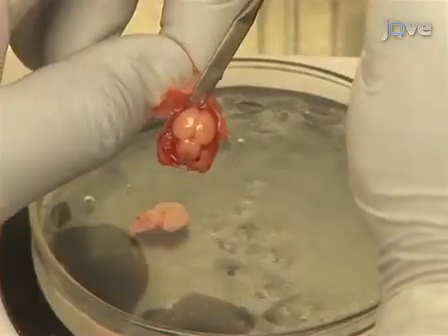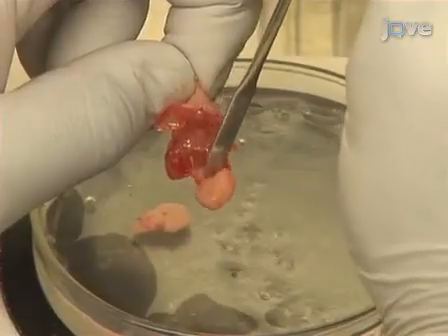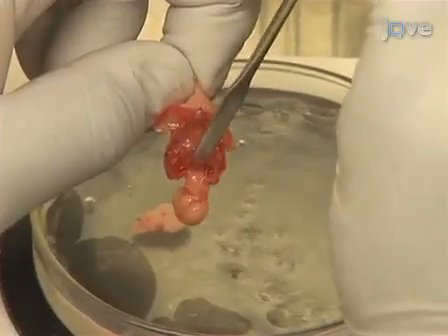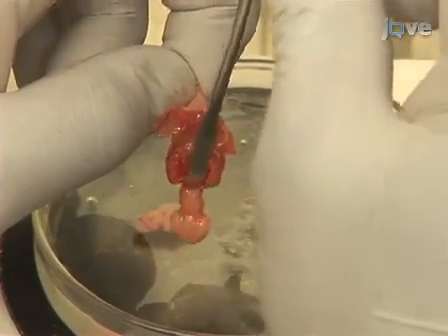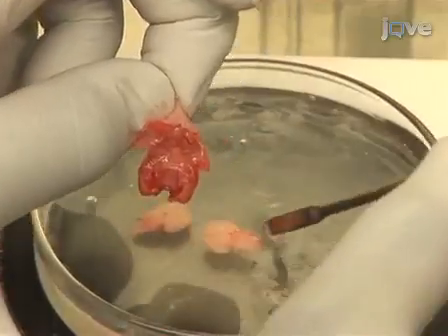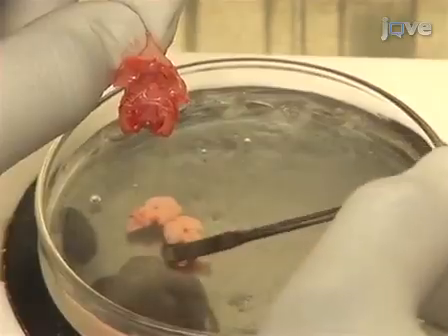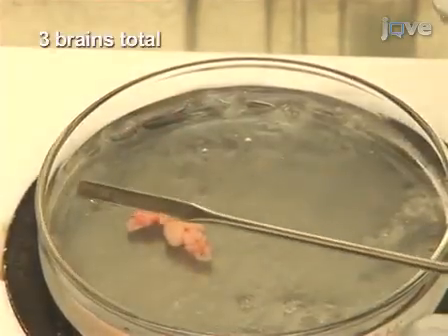Next, with a sharpened spatula, cut frontally through the olfactory bulb. Then, advance the spatula caudally underneath the brain. Gently lift the brain out of the skull and let it slide into chilled gey's solution for rapid cooling and temporary storage. Repeat the above procedure for 2 more brains.